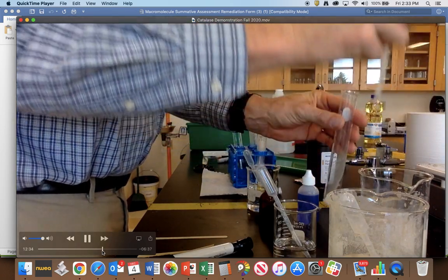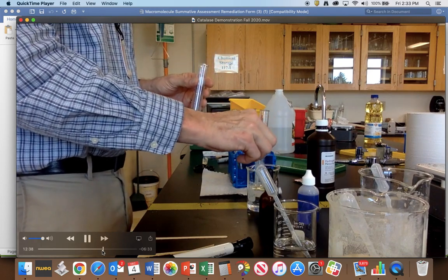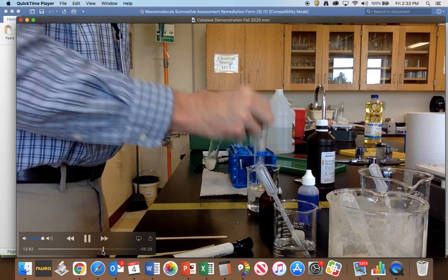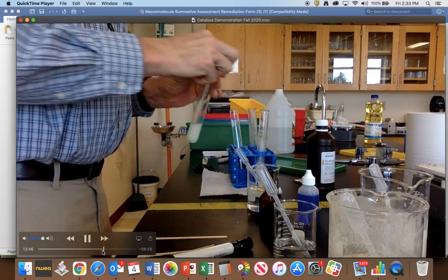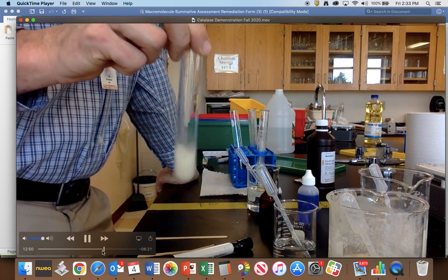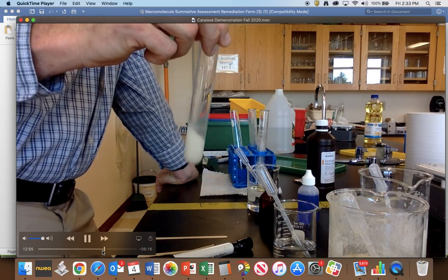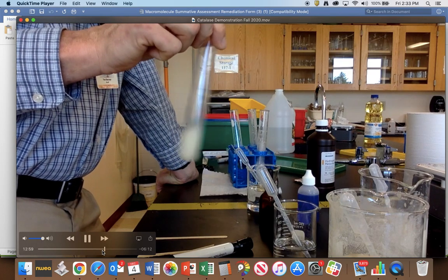So this is adding now some good yeast, so some of the stuff that's living. And now I'm going to mix it with some vinegar. And catalase works best at a pH of about 7. So mixing that together with the vinegar, which has acetic acid in it, means that the vinegar is going to denature the enzyme. So this shows that there's an effect on the enzyme when there are changes in pH also.